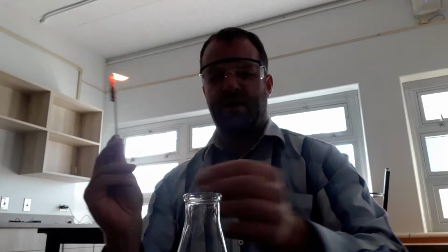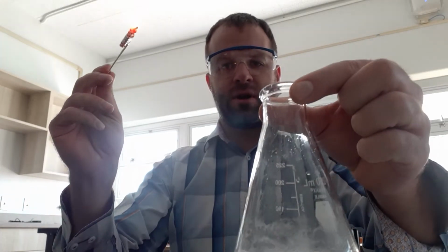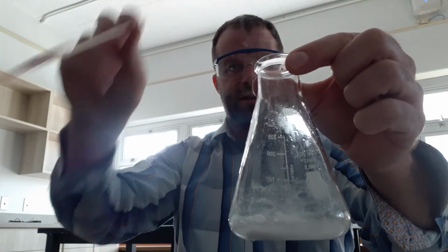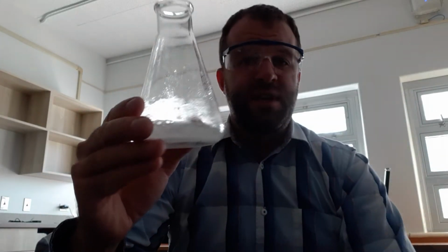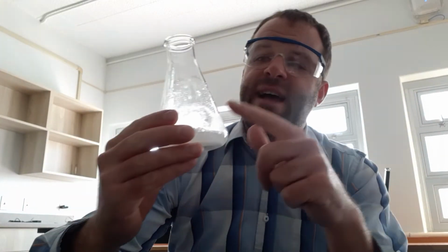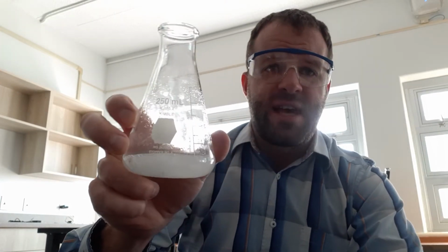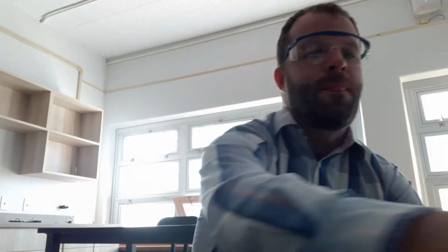And when we do so, I put this flame into our carbon dioxide. Okay, it goes out almost immediately. The reason it goes out immediately is because this flask is completely full of carbon dioxide. It pushes out all the air that was in our flask outside of our flask. So now we just have CO2 within our flask.